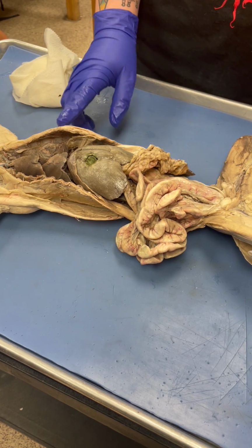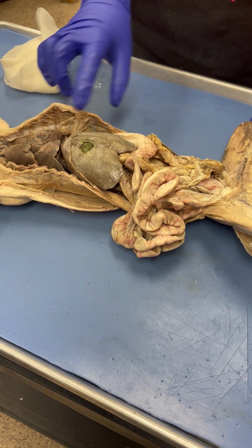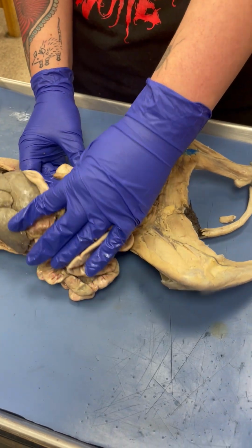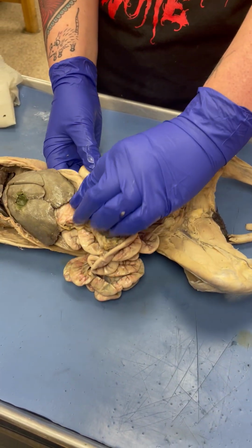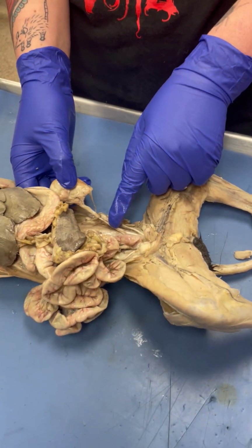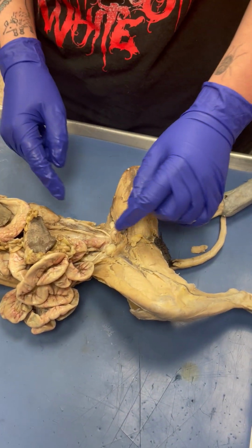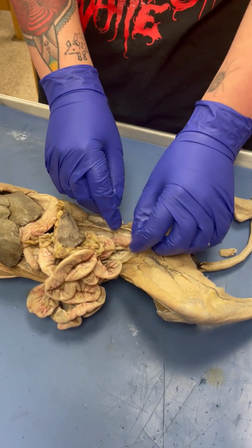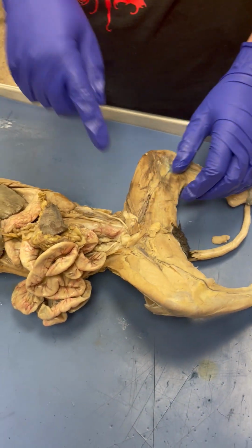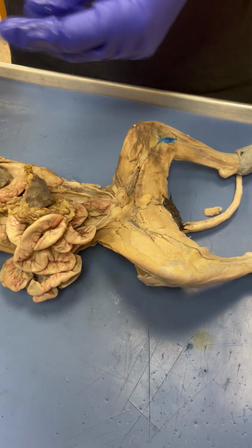Okay, so that was digestive. Then for, what's next? Urinary? For urinary, we have the kidneys. What's the little party hat on the kidney called? Adrenal gland. Yes. Okay. And then the tube that runs out of the kidney and down to the bladder, what's that? Ureter. And then the bladder is here. Normally it looks very much like a balloon. Bladders are so different, they're so inconsistent. I think maybe she had urine in hers and so it's solid and that's why hers is hard, but on the male cat it's very balloon-like.